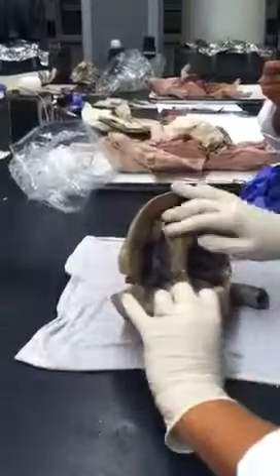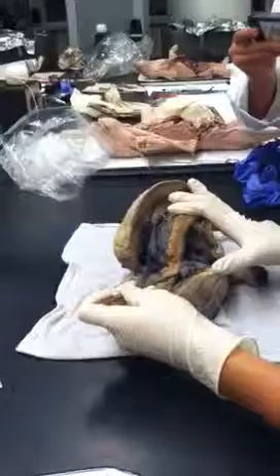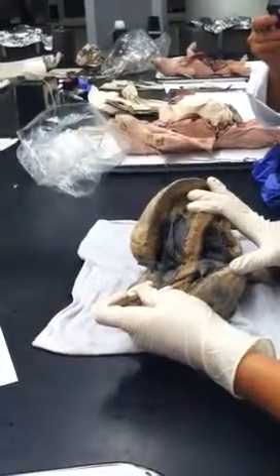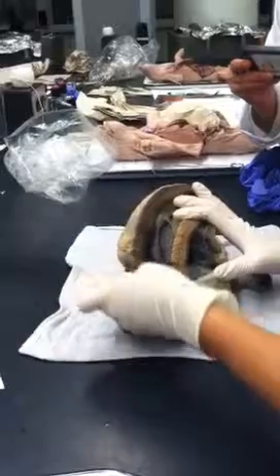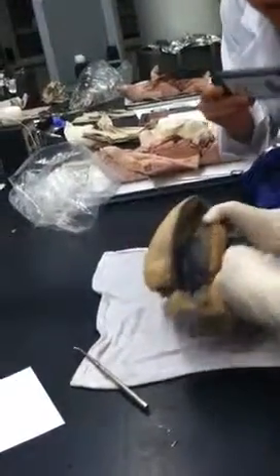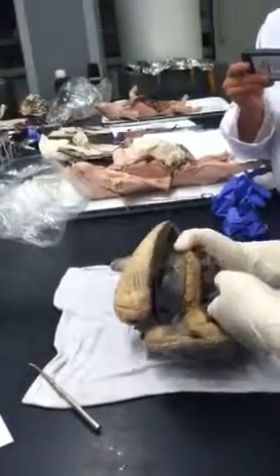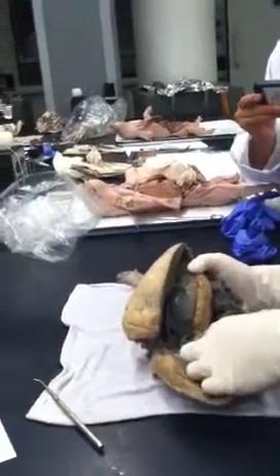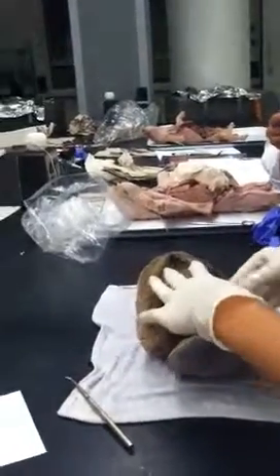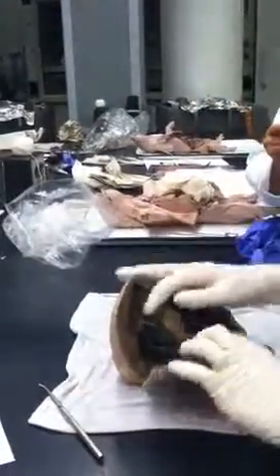All right, so if I open this up, this is a great example of a cusp right here. A flap is a cusp, and then these things, it's actually easier against my white glove, those are the chordae tendineae. Are there three in the tricuspid or is it just a name? No, there's three. This is one, there's another one up here, and the third cusp has been cut, so you can't really tell. But this is a great example of a cusp.